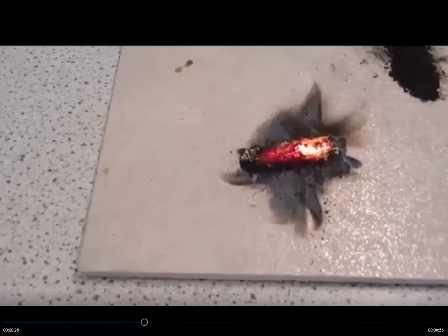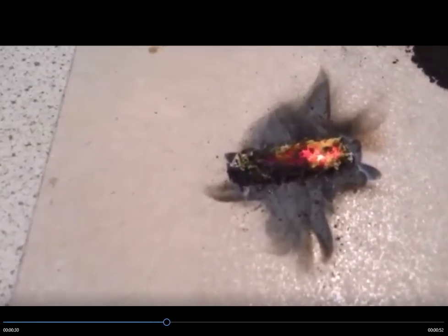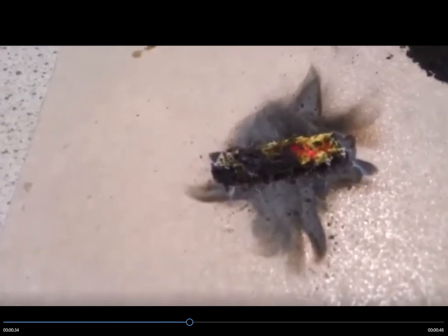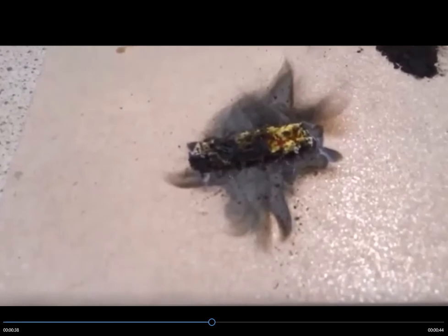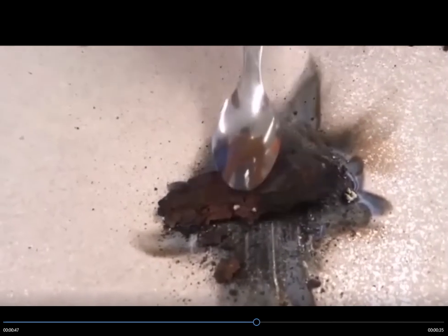The other two observations you can make is if you look at it, you'll see there's a yellow solid. But if you look around the edges where that's cooled down a little bit, it turns white. Now, a substance that's a yellow solid when hot and cools down to white is zinc oxide. So we had zinc and copper oxide, and that's now given us zinc oxide. So the other substance must be copper.